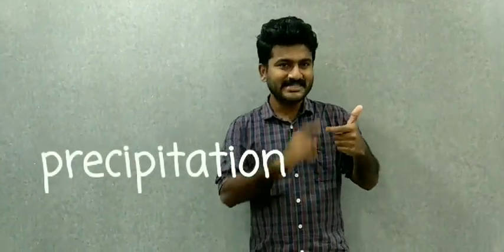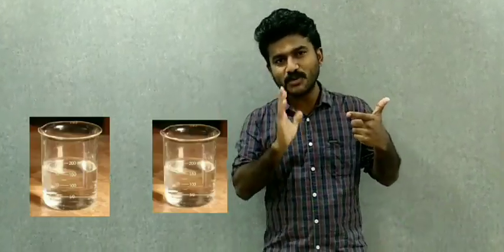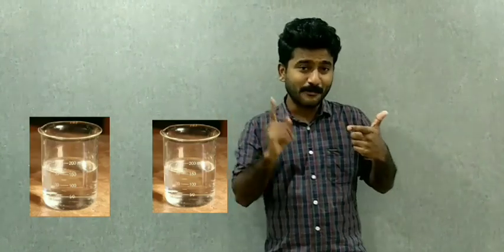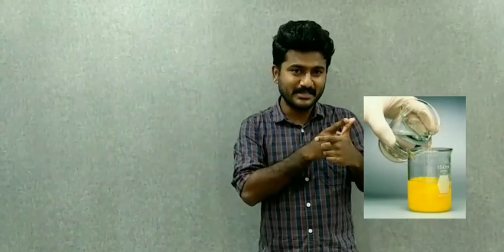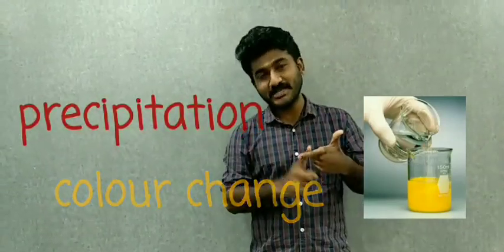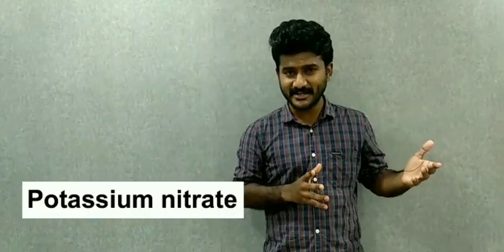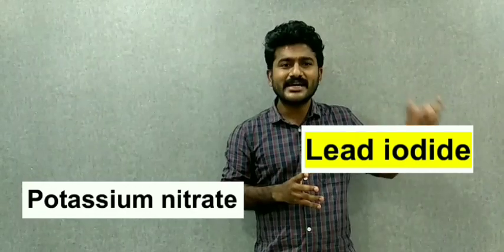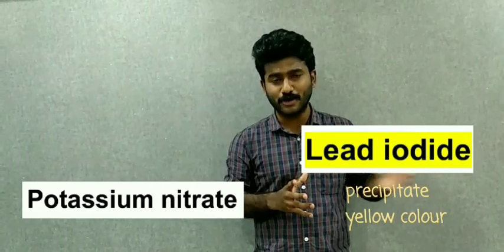That means two things have happened here. One, precipitation has happened. Second, color has changed. Both lead nitrate and potassium iodide were colorless in nature, but when they mixed together we got a yellow color precipitate. That means precipitation is formed and color change is produced. That indicates a chemical reaction has happened here. And what are the products obtained here? The products obtained here are potassium nitrate and lead iodide. Lead iodide is the precipitate formed here, and that is the reason for the yellow color.